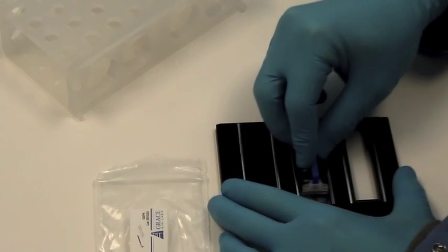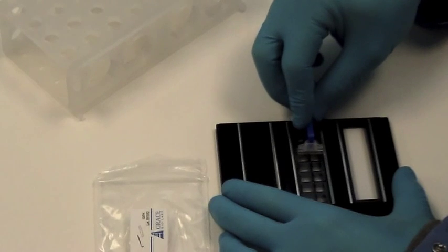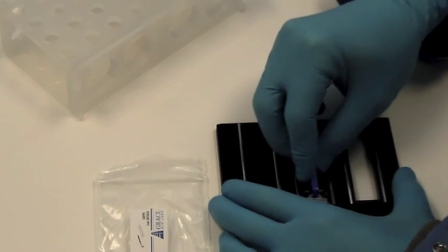The sealing tool is used to press the seal strip over the entire assembly and seal the top of each chamber.